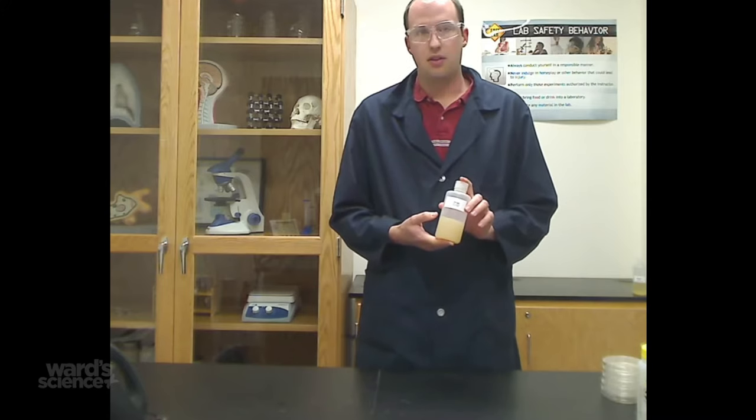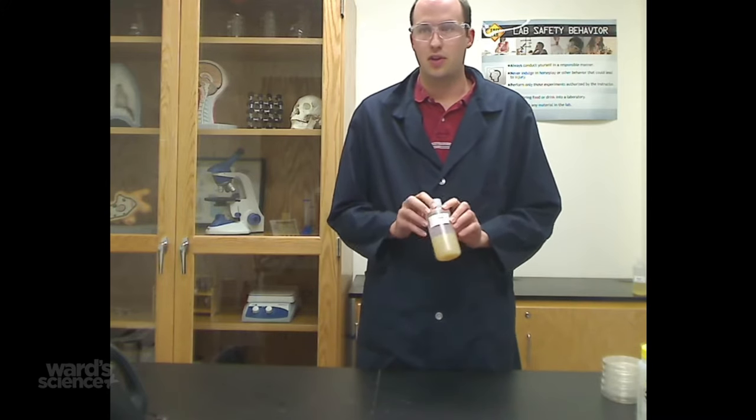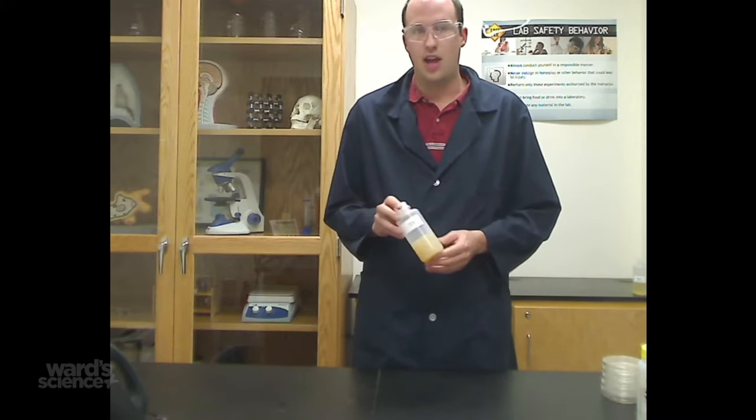First of all, when you receive your bottles of agar, you'll have a bottle that has about 125 milliliters of solid agar and nutrients inside.